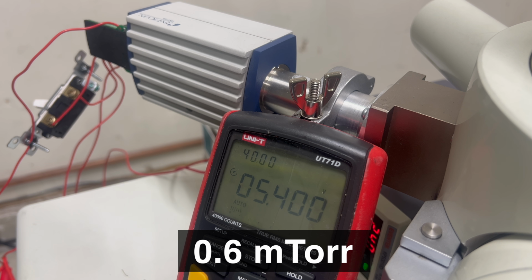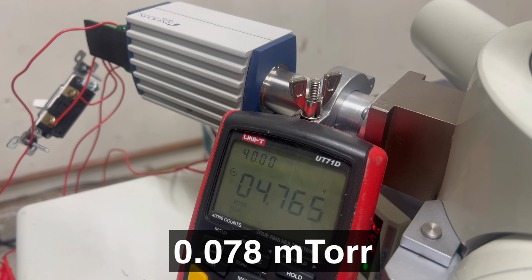I was certain that I'd have to replace the oil in the diffusion pump, but it looks like the pump is operating just fine. After a couple of minutes, it reached a pressure of about 10 to the negative 4 torr, which is about 500 times lower than what it was in the pre-evac mode. This is well into the high vacuum region, and is an acceptable pressure for running the machine. Awesome! Now that the vacuum system is working, it's time to see if the machine is functional.